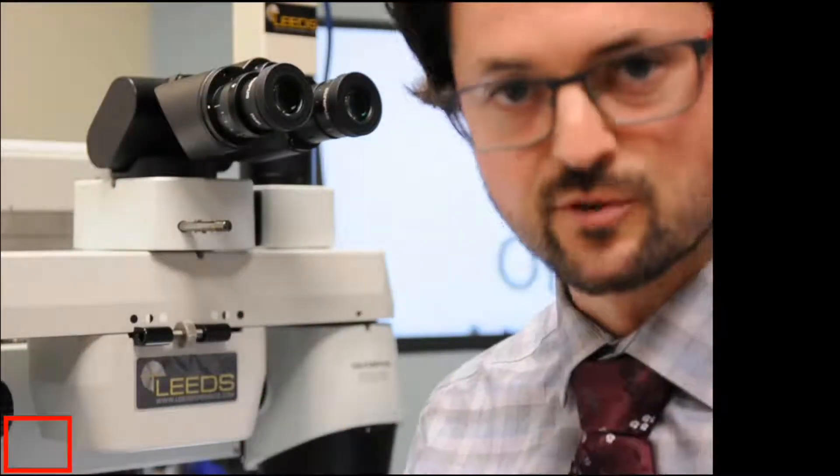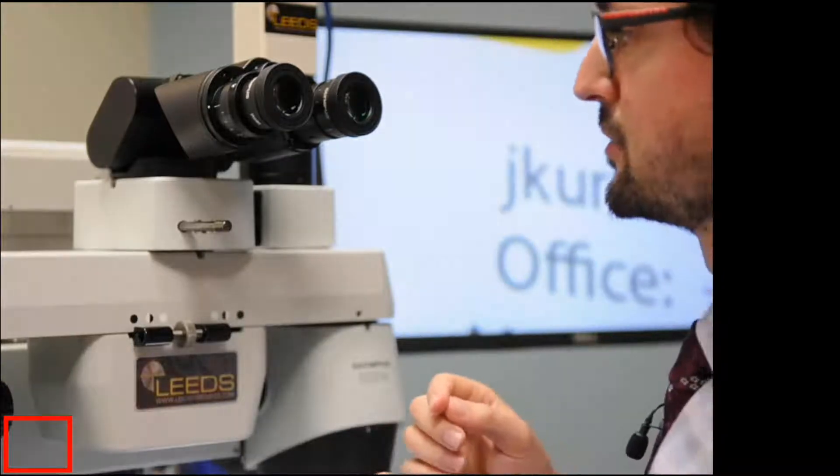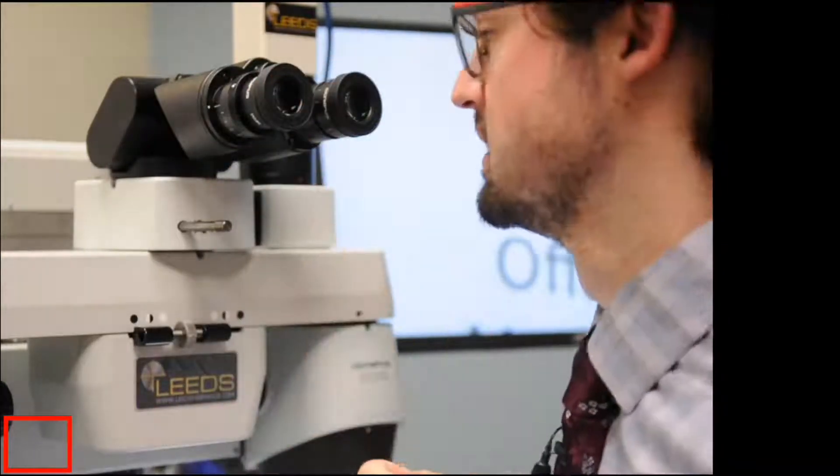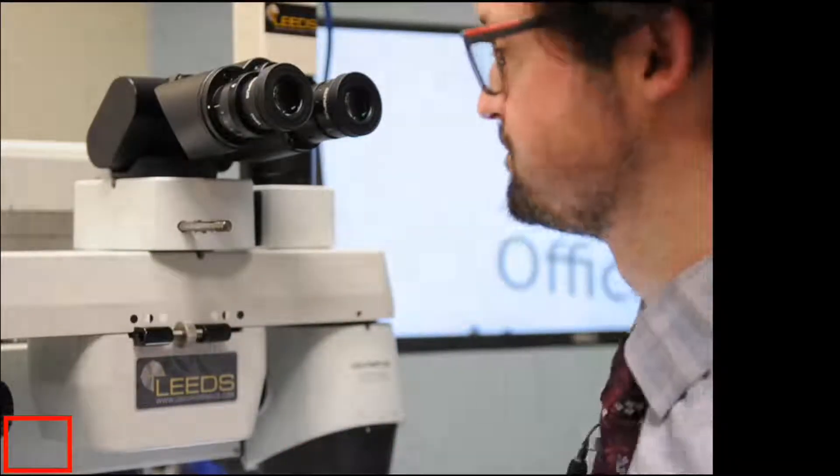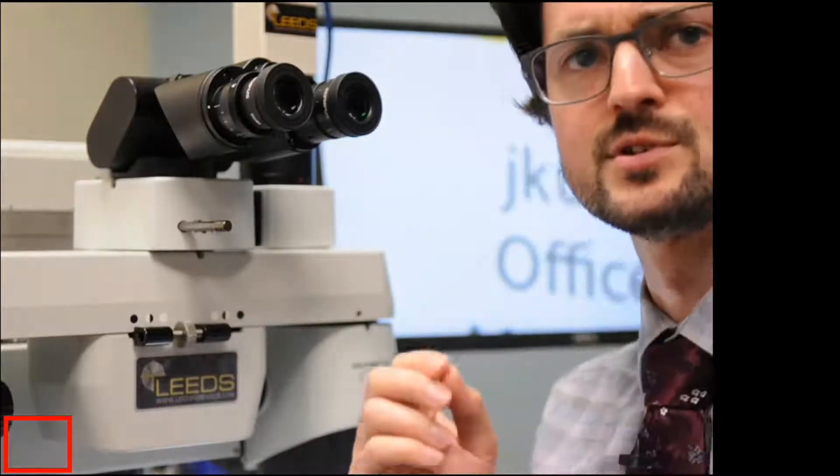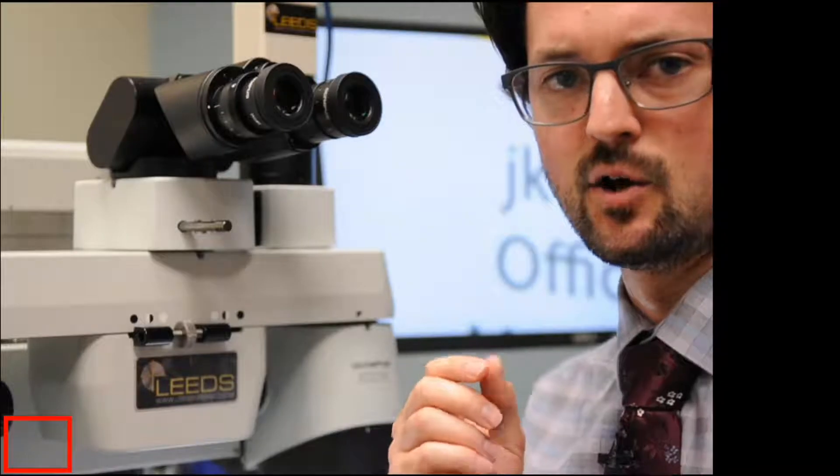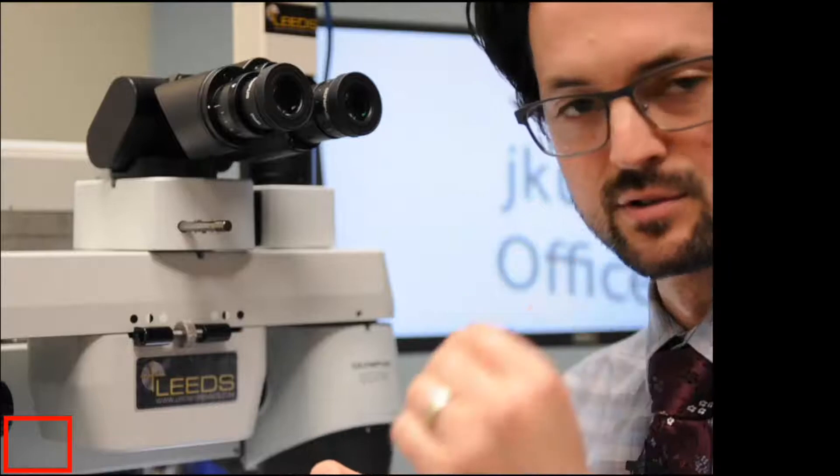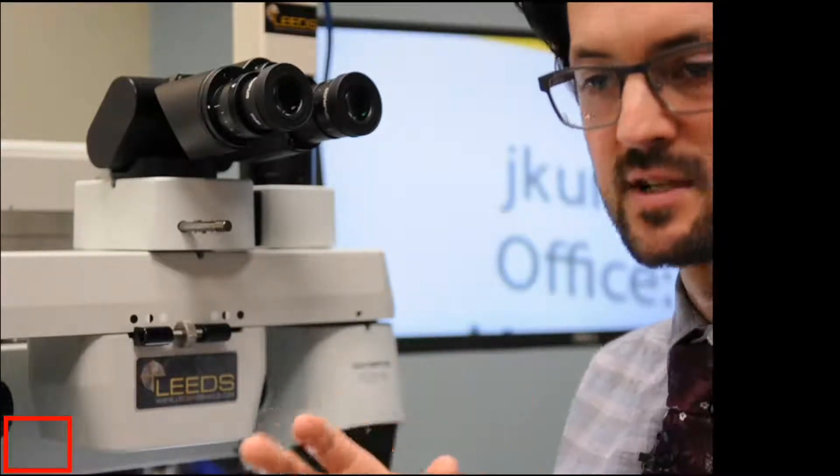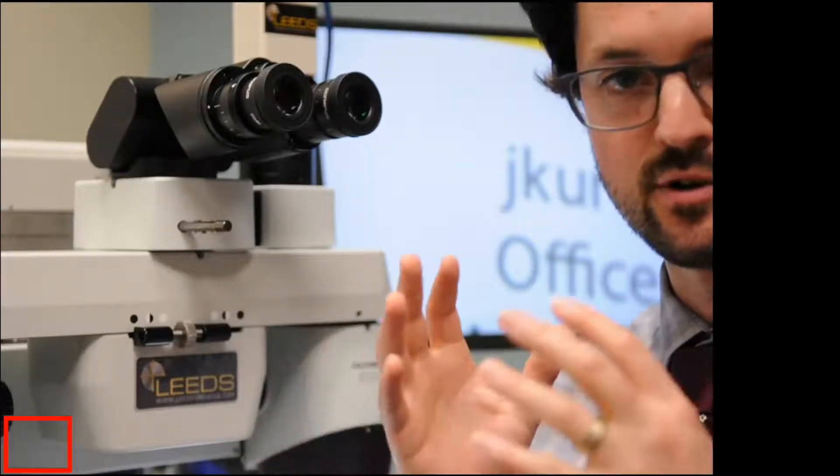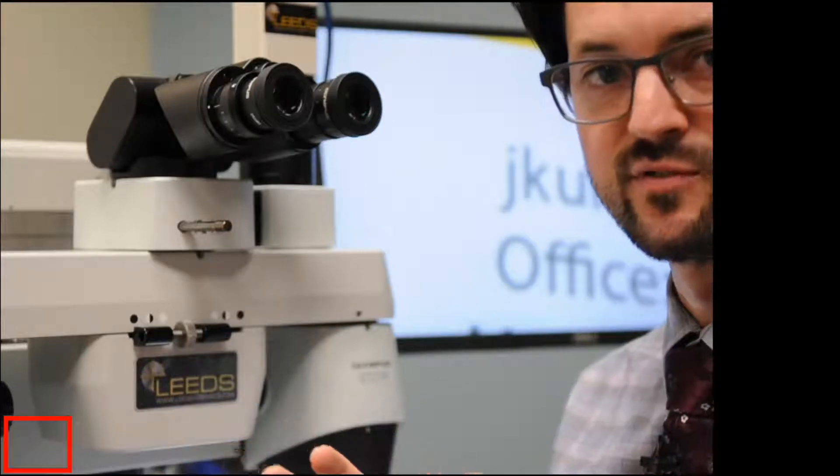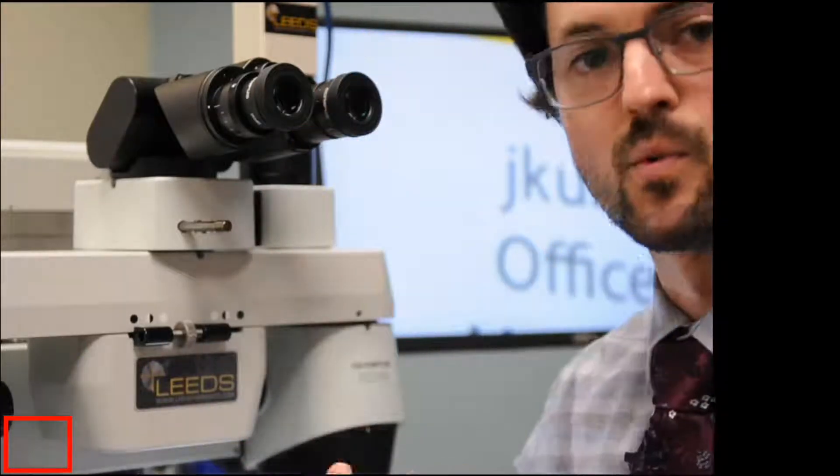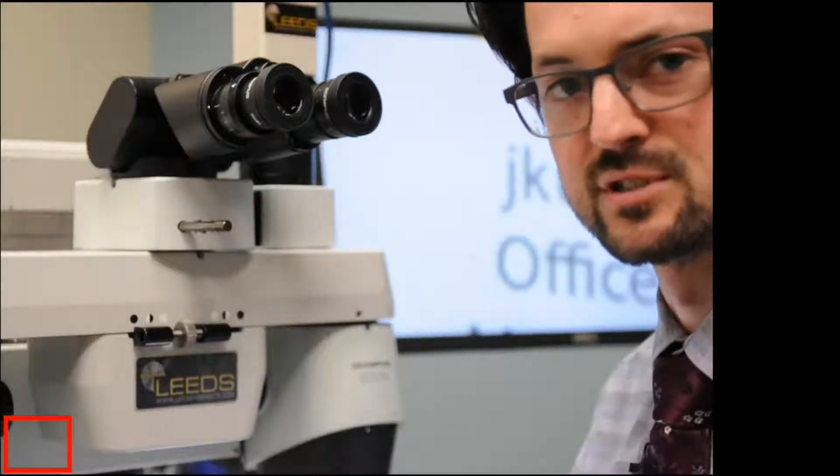If you're having a hard time getting it in focus, what you can do is you can cover the alternate eye. You can definitely do that. I'm just using both eyes. What I do recommend doing, though, is leaving your eye open if you do cover it. Because what can happen is if you cover an eye or close an eye, your brain itself is going to try to adjust your eye's lens to bring the image into focus faster than what you can adjust here. And so it won't necessarily, this technique won't necessarily work the best.